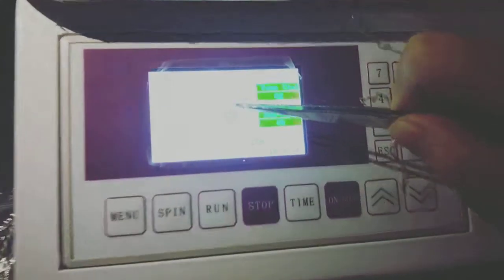Then we can see the time is calculated. After 20 seconds, it will automatically cut one piece.